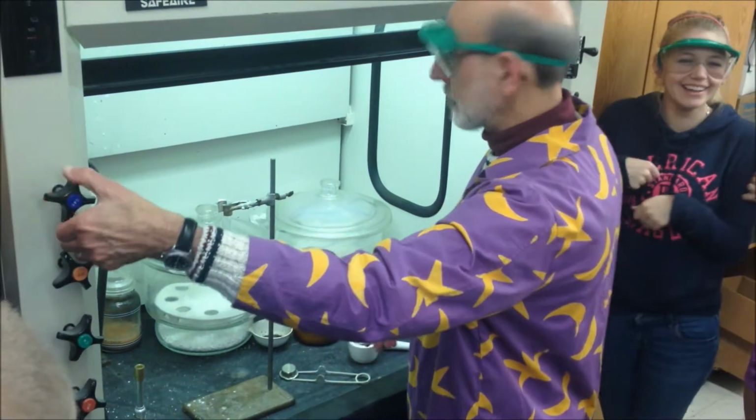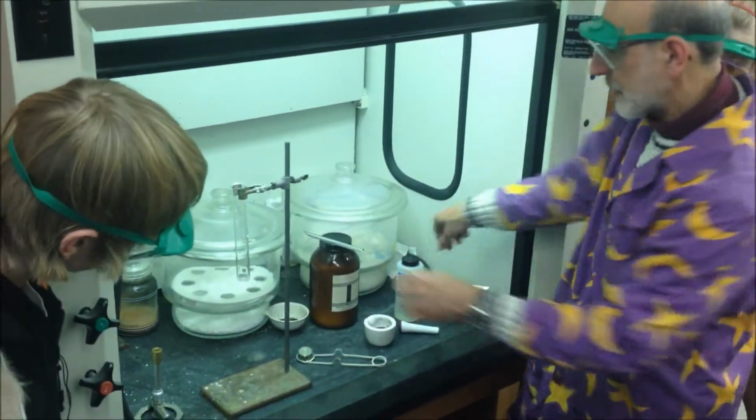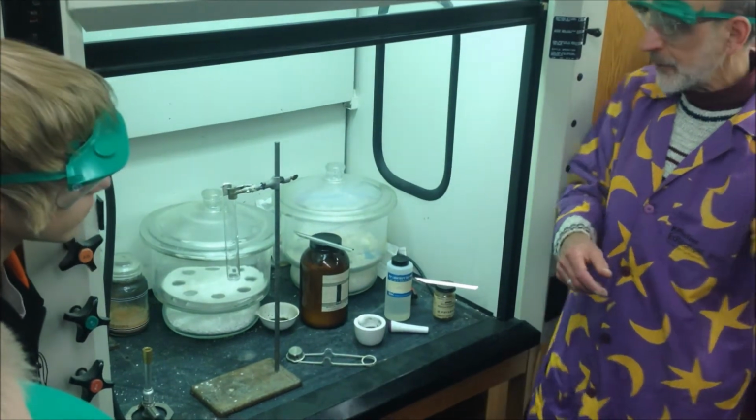Okay, so now I'm ready for this to react. So now I'm going to sacrifice a gummy bear.